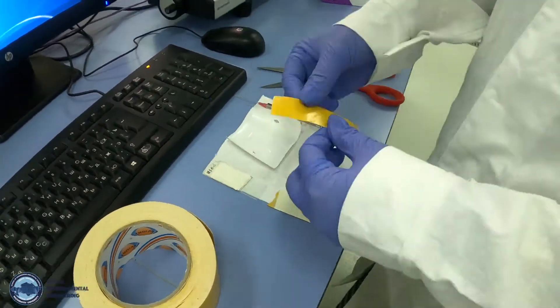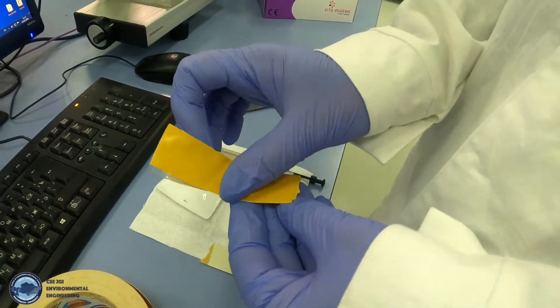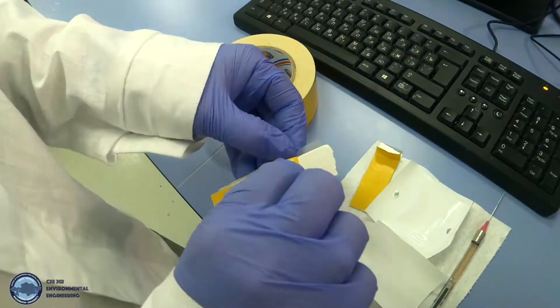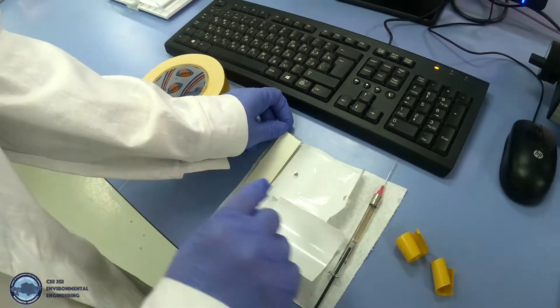The rest of the cut tape will stick on the next glass plate. Now we will pull out the protective cover of the tape.